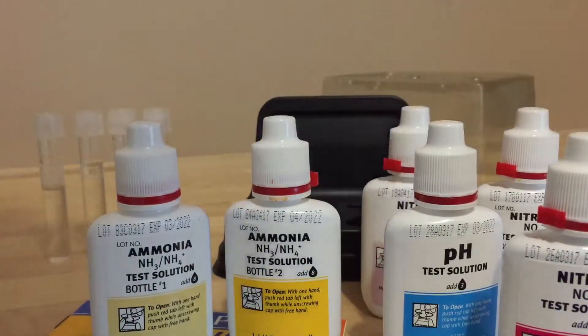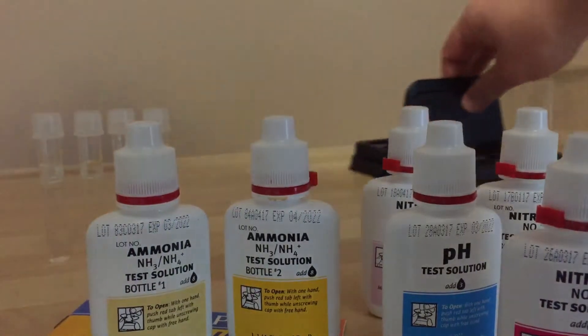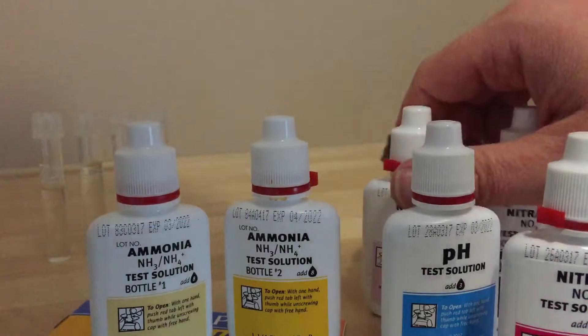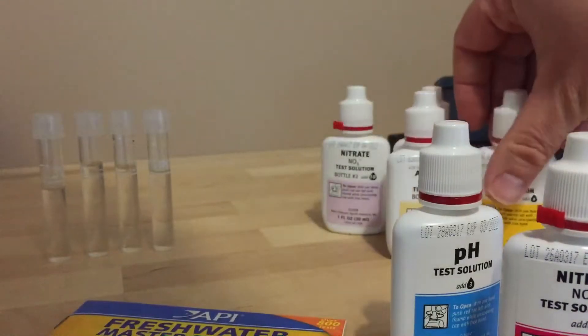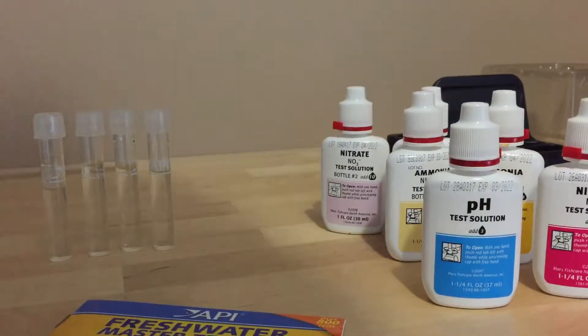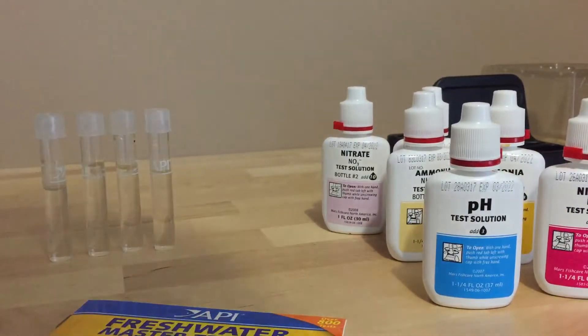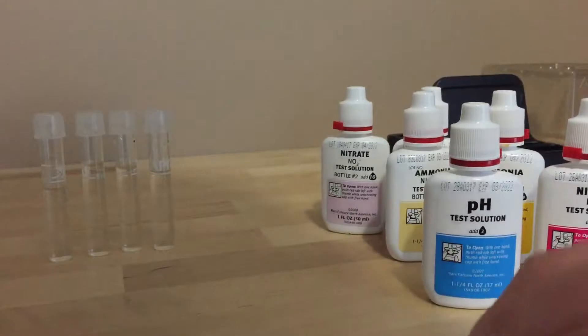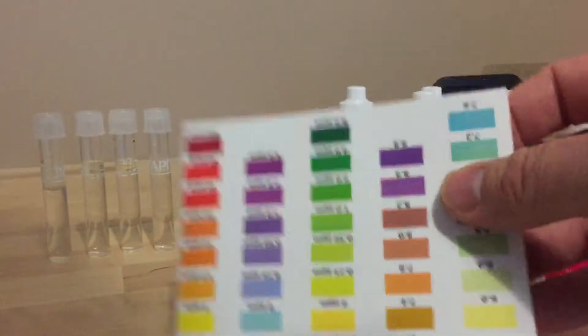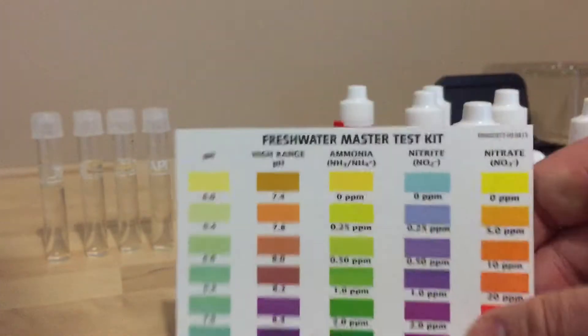Also there's a nitrite test and then there's two for nitrates. So at the minute I'm cycling one of my smaller tanks and I thought this would be a good time just to show you how to use the test kit and for myself to find out whereabouts in the nitrogen cycle my tank is.